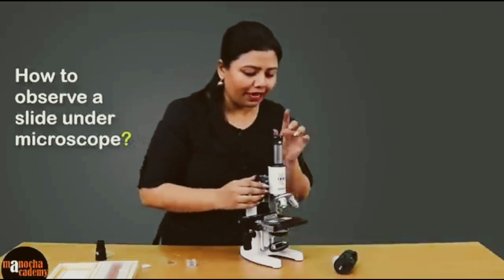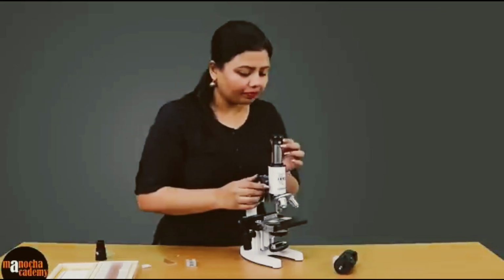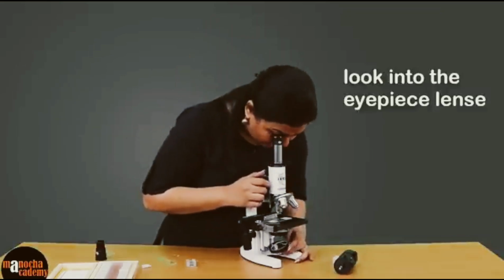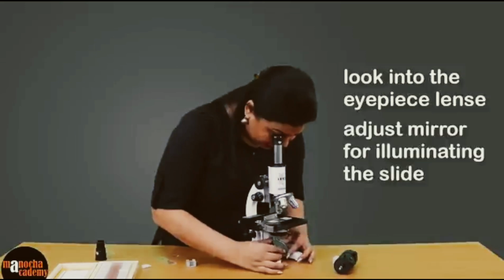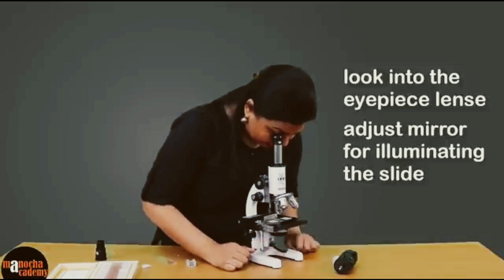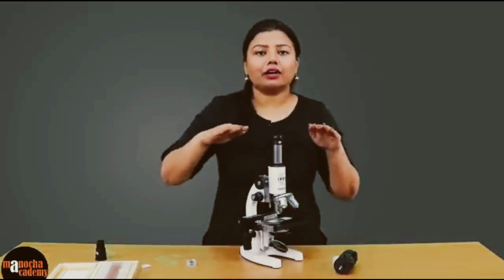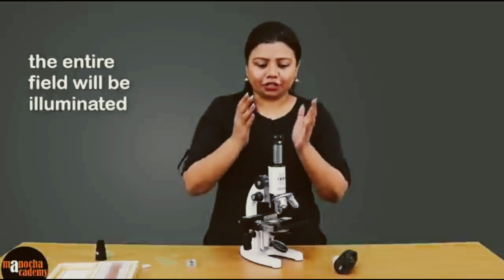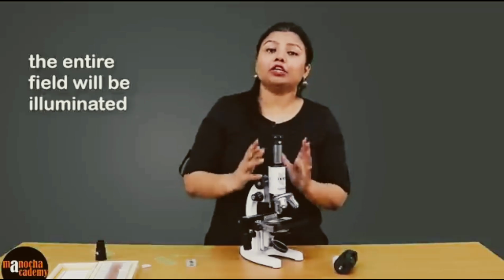So how do we observe it? We will have to place our eye on the eyepiece lens and make sure that the mirror is collecting enough light and focusing it on the specimen. When you do that, you will see that the entire field that you can see under the microscope is lighted up, is illuminated.